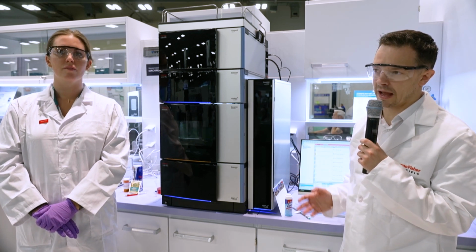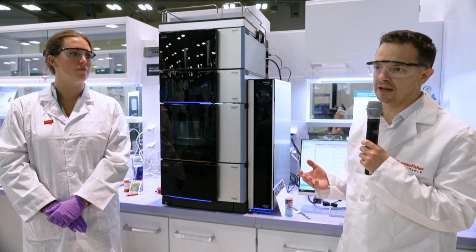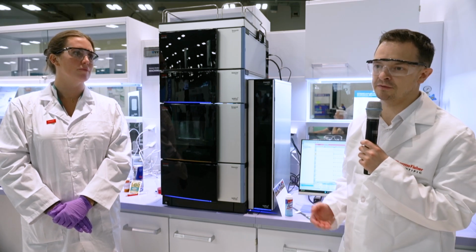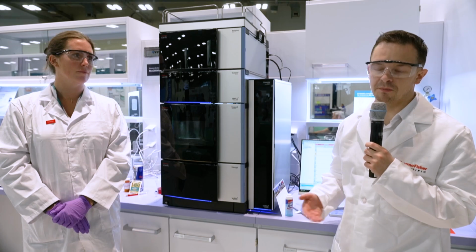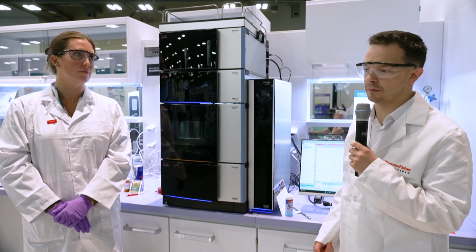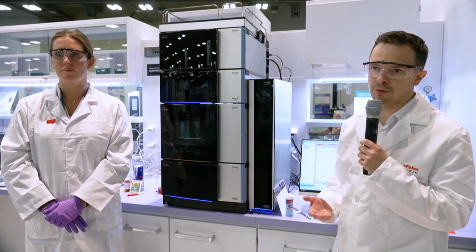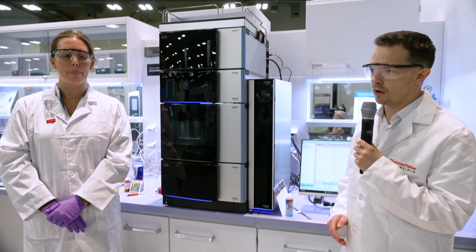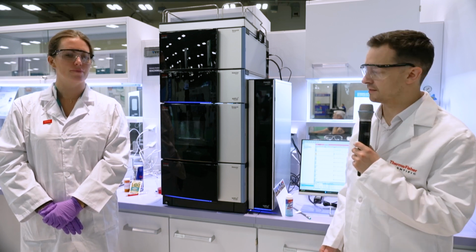The purpose of Polysorbate 80 is that it's a surfactant and an emulsifier that helps stabilize the compounds. So it'll help increase the shelf life so they don't break down, but it also has an added role in that it helps the body absorb the treatment. And because it's absorbed by the body, it's very important to monitor the impurities and make sure that it's manufactured to within tight standards.